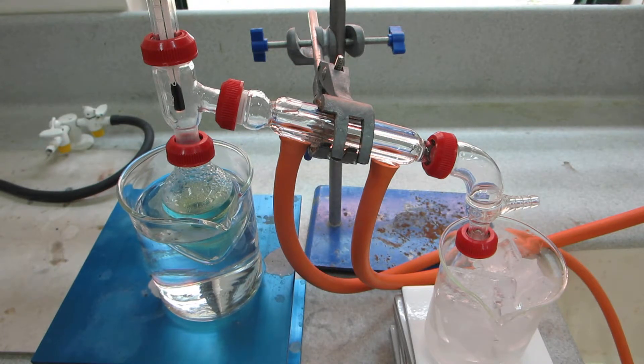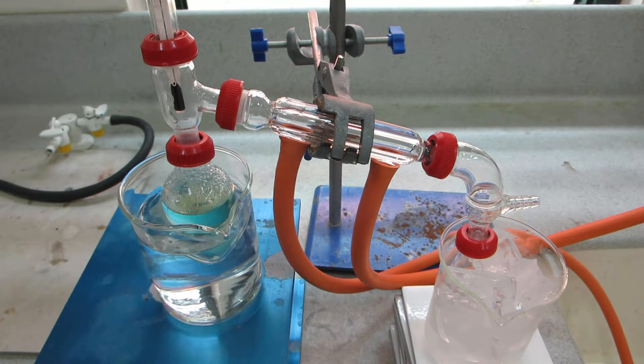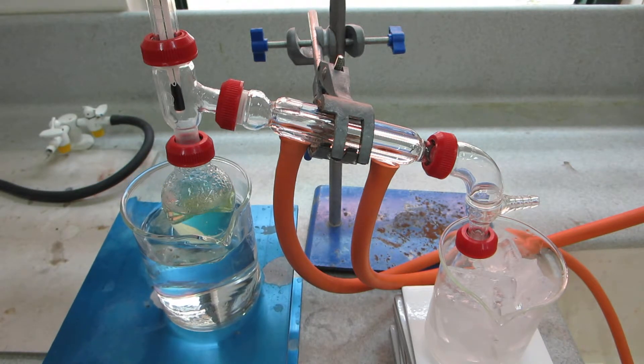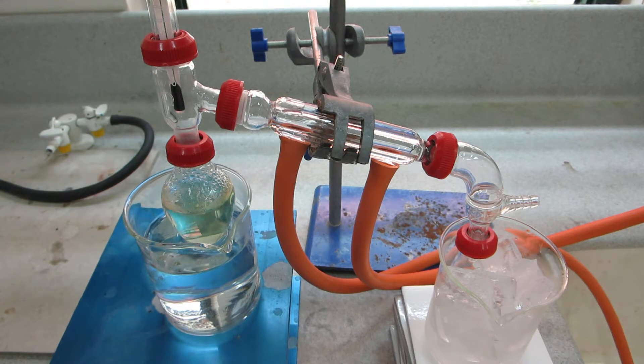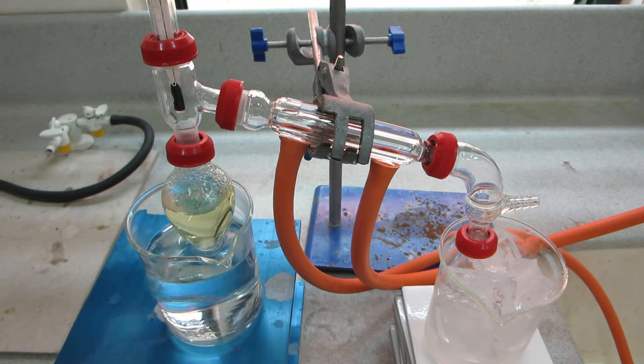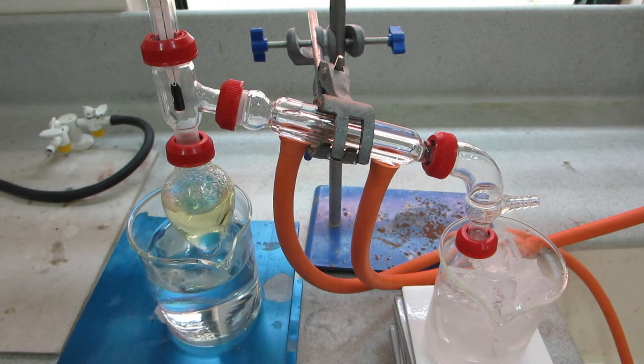So we'll, at this stage, when we've got some bubbling going on, lower the hot water bath, and we might be able to see what's going on.